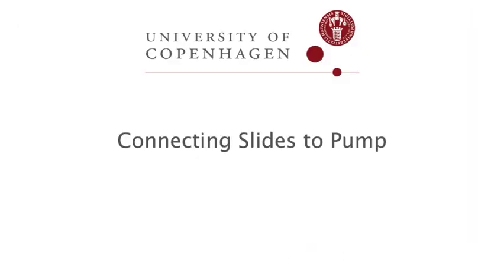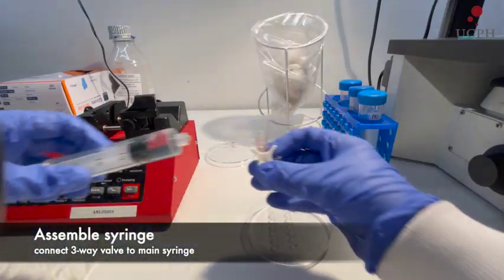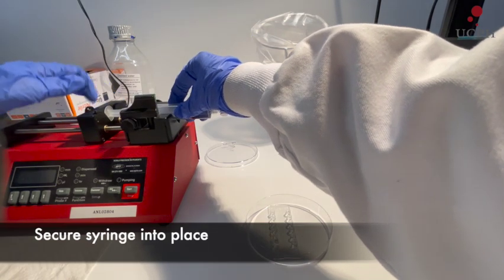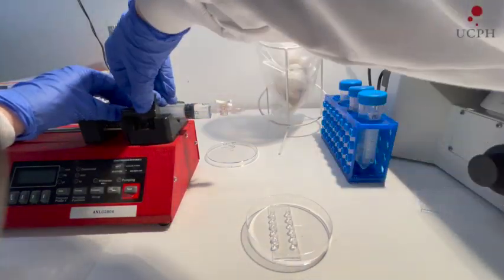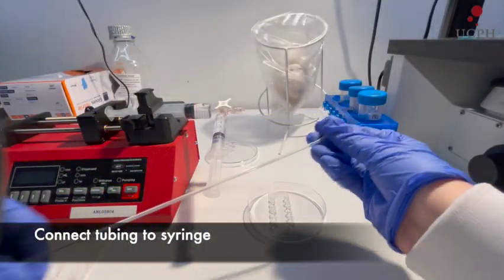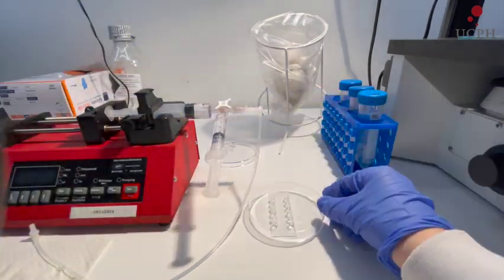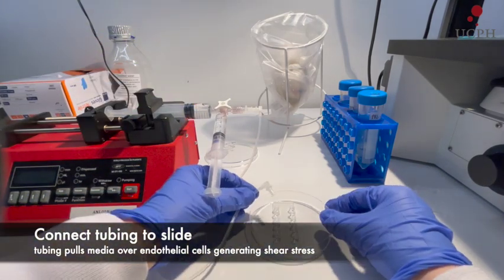Connecting slides to the pump. Once the parasite suspension has been prepared, it is time to connect the slide to the pump. First, attach the 3-way valve to the 20 ml syringe. Then place the 20 ml syringe into the pump and secure in place. Connect a smaller syringe to the 3-way valve. Then connect the plastic tubing to the remaining port on the valve. Finally, connect the tubing to one of the reservoirs on the channel slide.